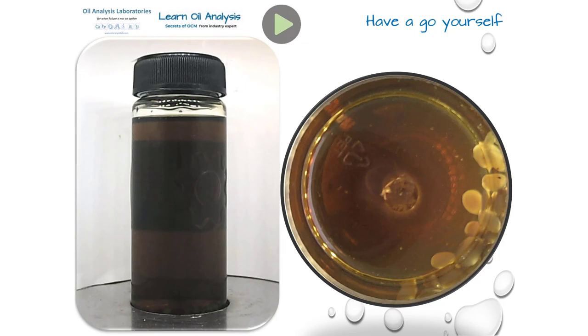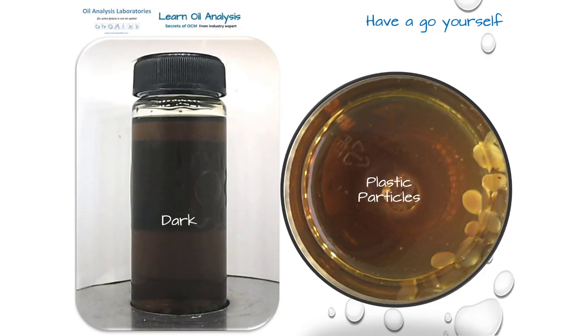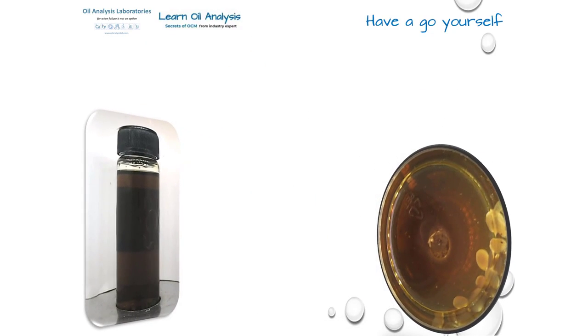This next one is a little strange. The particles are actually plastic. This machine is an injection moulding machine that moulds plastic, and these little beads are part of the material used to make the final plastic, called master batch. You can see these particles better under the microscope too.